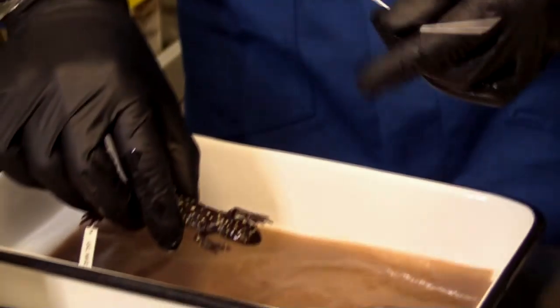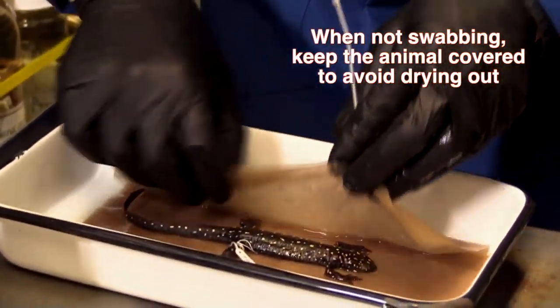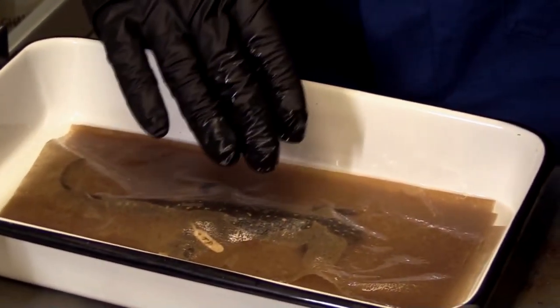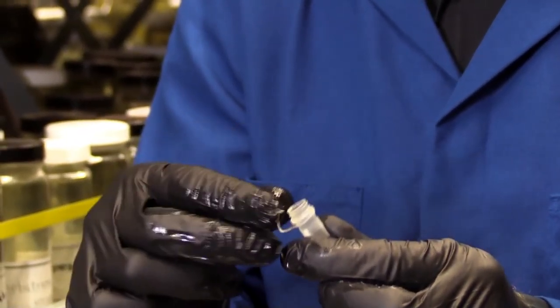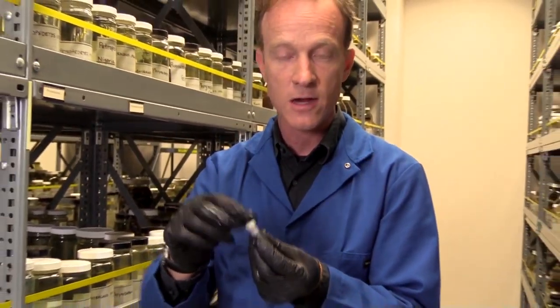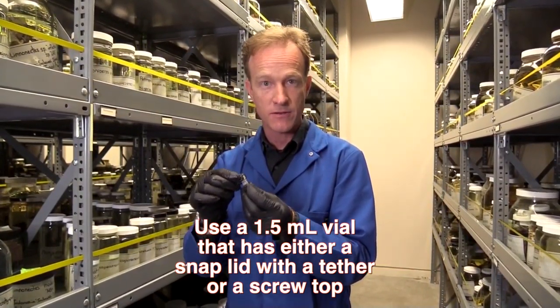Now I'm done. I'm going to put him down, keeping the swab from touching anything else, and I'll cover my specimen with a moist towel so it doesn't dry out — that's very important. Next, I break off my little swab and put it in my vial. Now we're ready to extract DNA and see if it's infected. You want to have a vial with a locking lid, because when you do the extractions you have to heat up the vial, and you don't want the lid popping off.